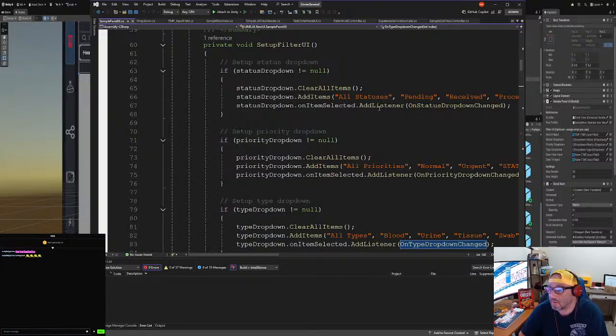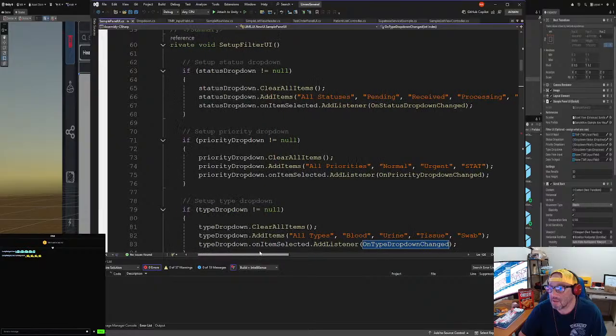So we added a drop down listener to run our own methods whenever we drop it down. If you see here, the status drops down, and we're manually adding the choices, the options. But I wouldn't suggest hard coding it this way. What I would usually do is make a table in Supabase, which is how you grab a list of this stuff, and then add it to this drop down. For brevity, we're just going to do it here. In a later video we'll bring that up and add it.